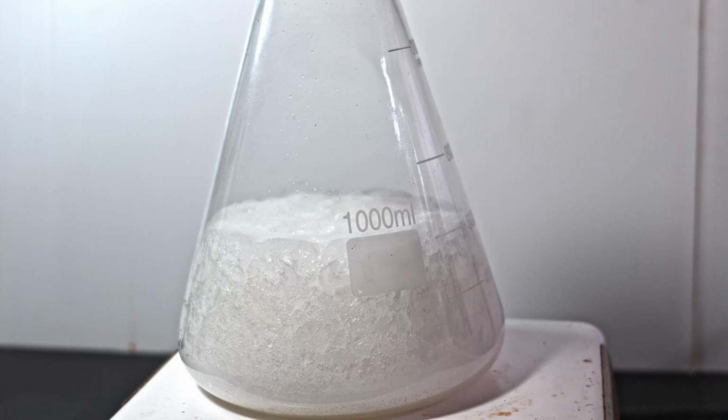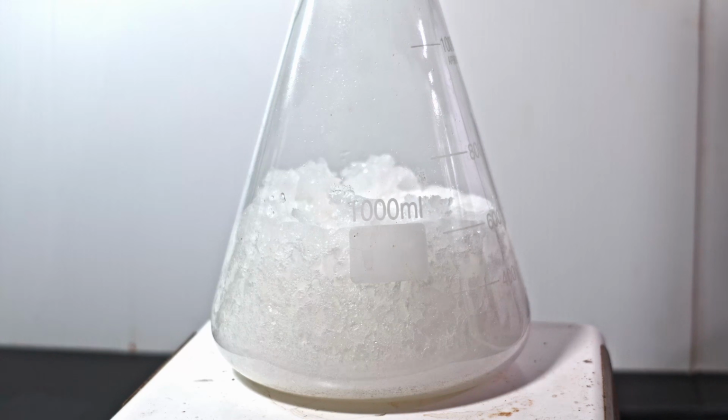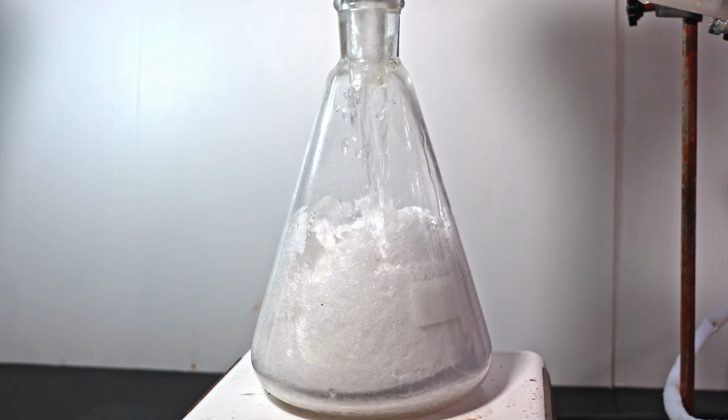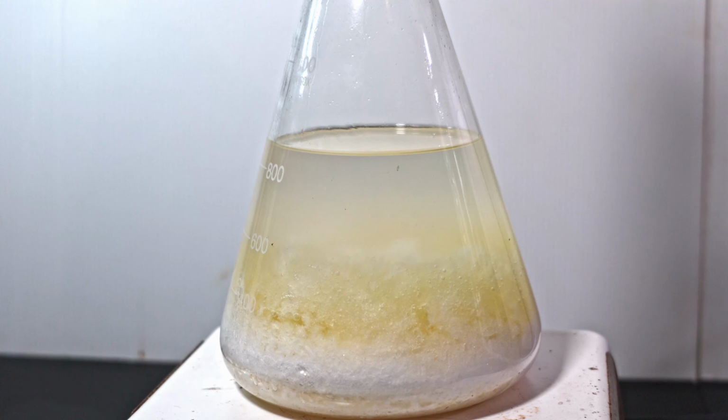It eventually becomes a wet foam. It can be easily stirred and crushed though. Breaking it up allows for better vacuum efficiency. Once I've gotten it plenty dry, I pour in 300 milliliters of ethanol. As I heat it, it takes on a yellow color that soon turns orange.